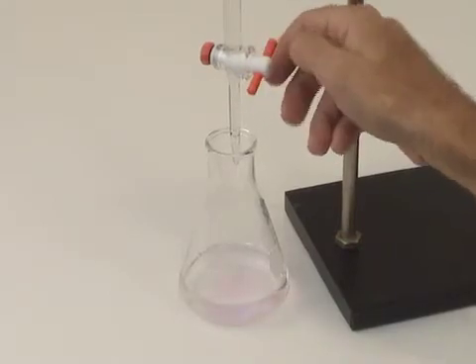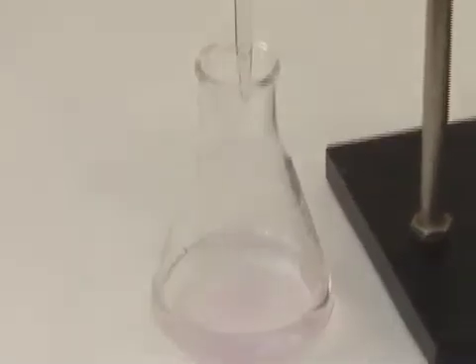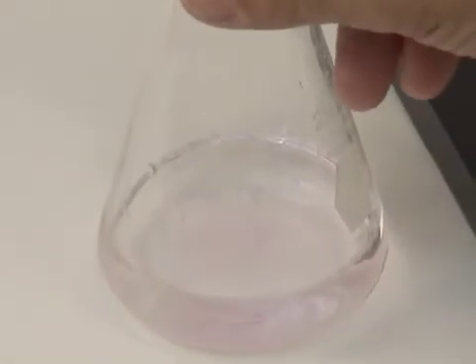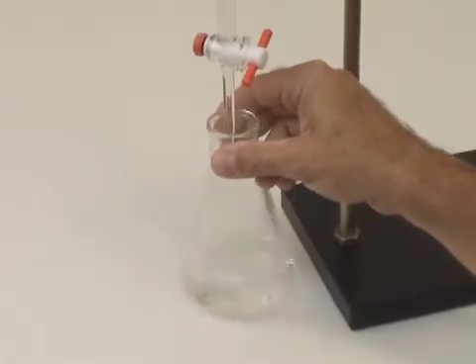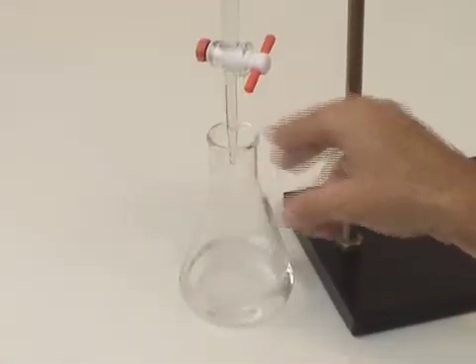If it doesn't, that means you've actually gone past the end point, and you'll have to start the titration over with a fresh sample. As we continue our titration, we'll be slowing down the addition of titrant, but we'll still be adding drops quite rapidly.